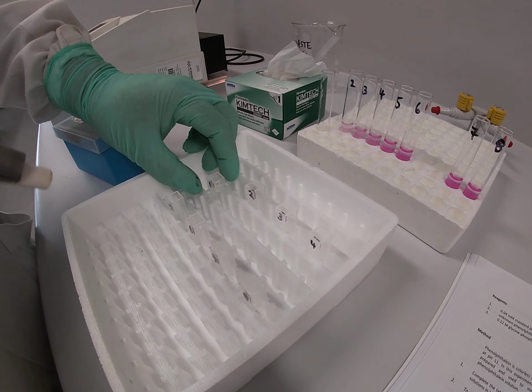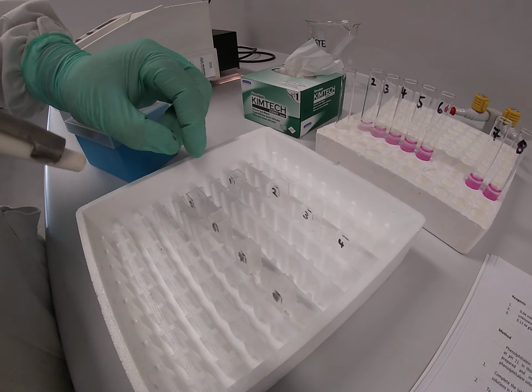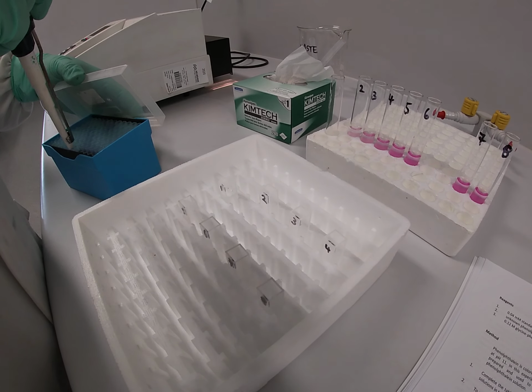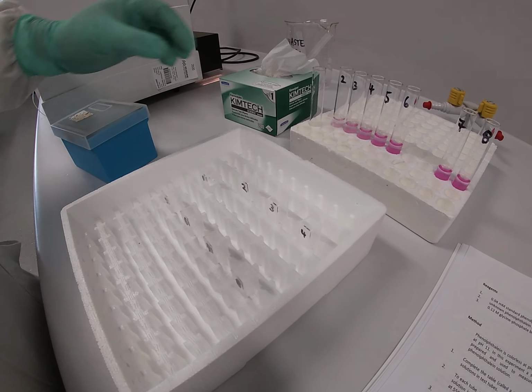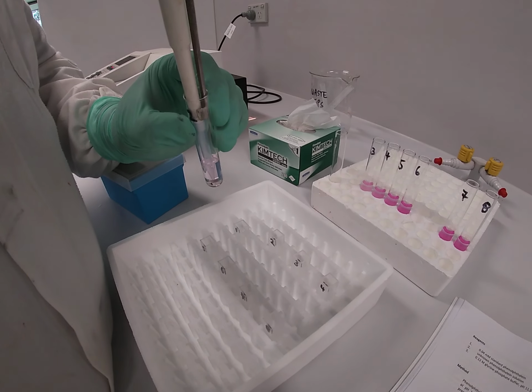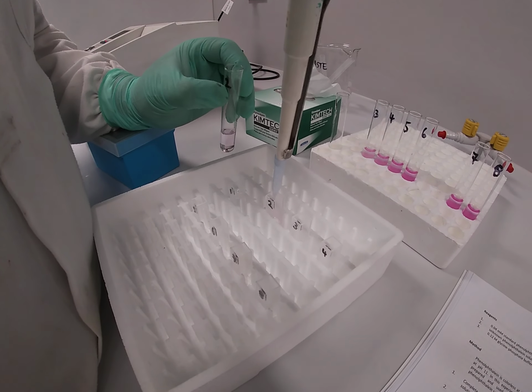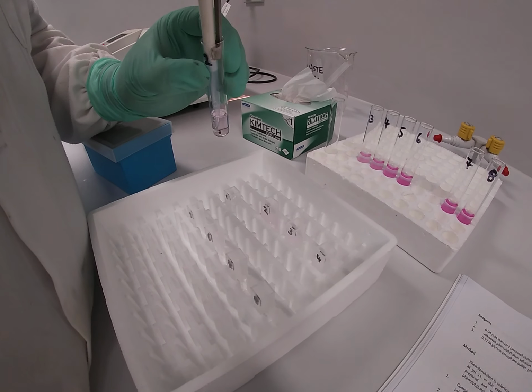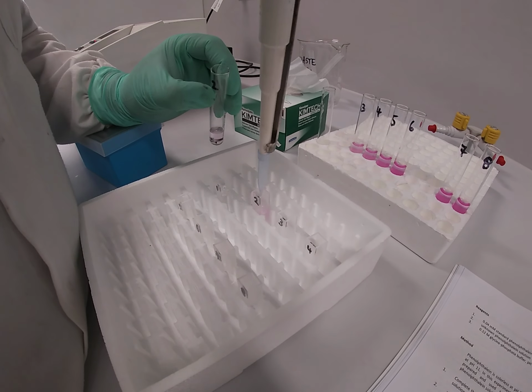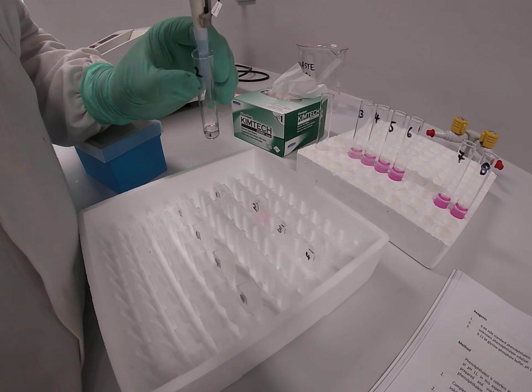Okay, so I've actually taken test tube number 1, filled up my cuvette number 1 and moved it forward, so therefore I know I need to now go to test tube number 2. And that's a common mistake that a lot of students make. And hence we go now to test tube number 2. I've used a new tip in order to make sure I don't cross-contaminate from test tube number 1 to test tube number 2.